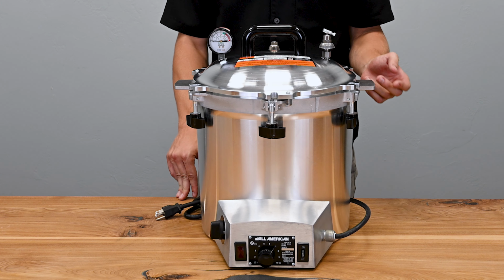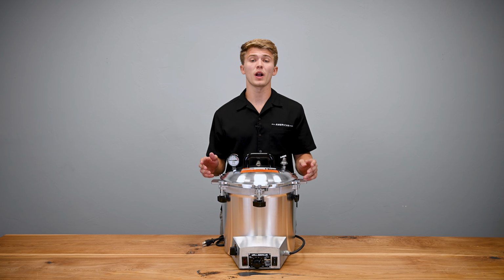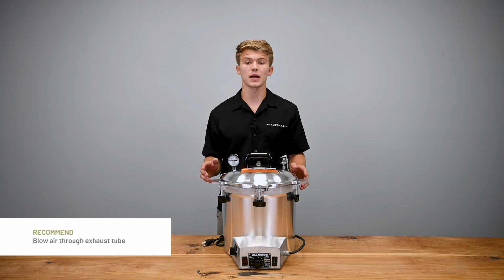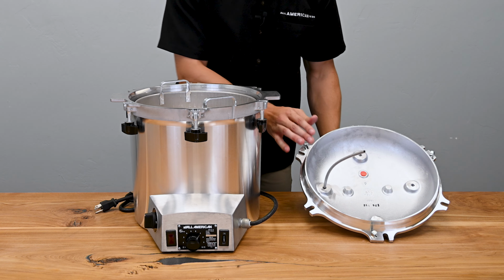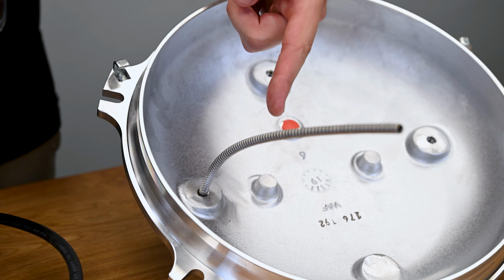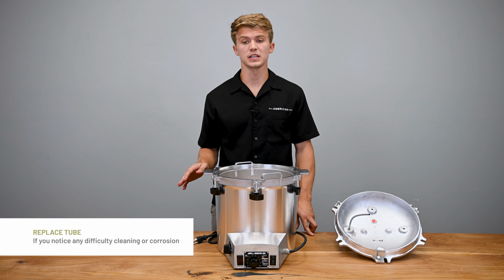Next, we will talk about the air exhaust tube. It is essential that the air exhaust tube is frequently checked to make sure that air freely passes through it. We recommend that you blow air through the exhaust tube to be sure that it is not plugged with any foreign material. Simply remove the air exhaust tube from the control valve on the bottom of the sterilizer cover. The tube may be cleaned using a small diameter wire running through the length of the tube several times. If you notice any difficulty cleaning the exhaust tube or notice any corrosion, please discard the tube and replace it with a new one.